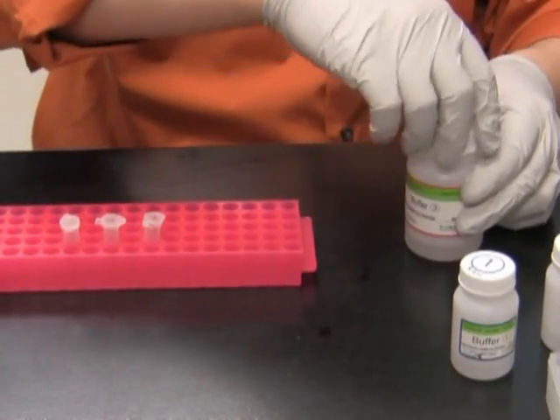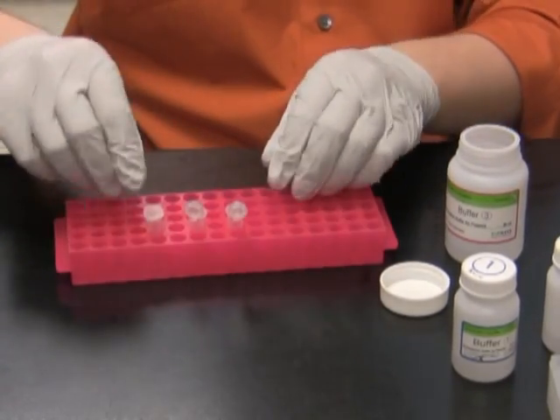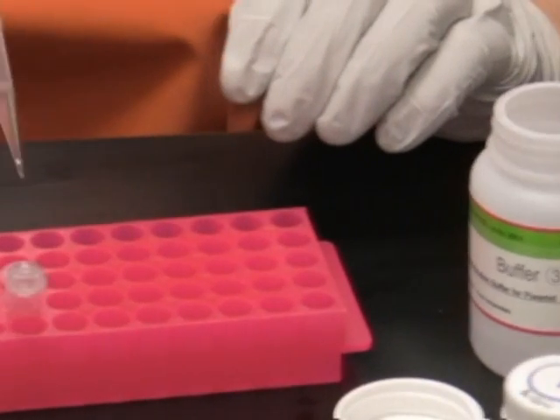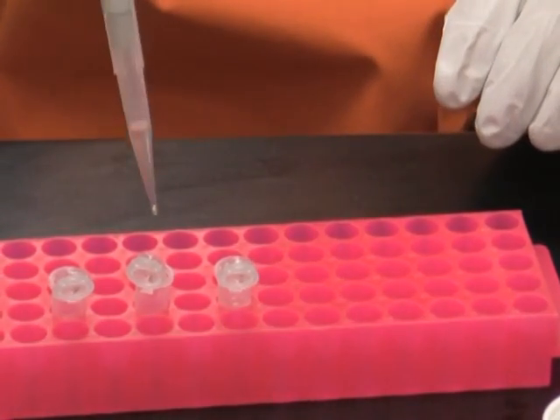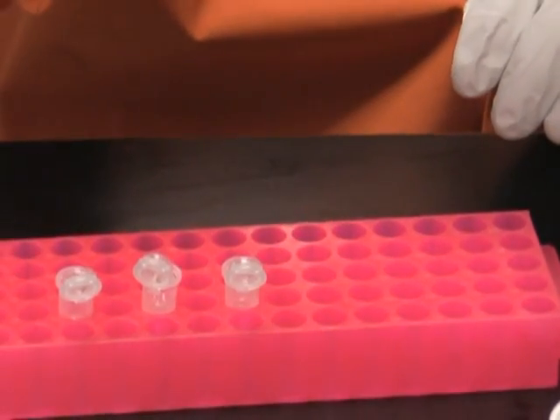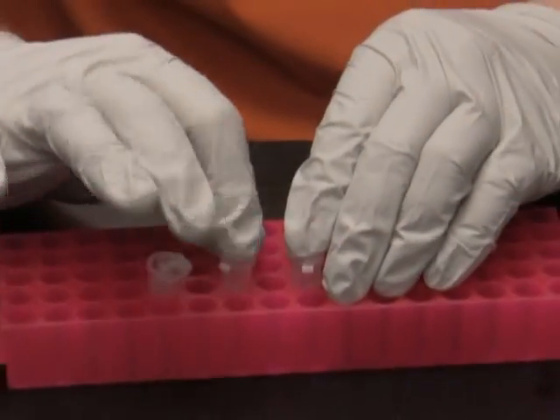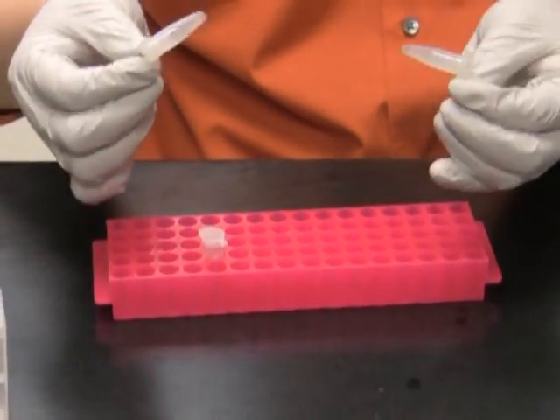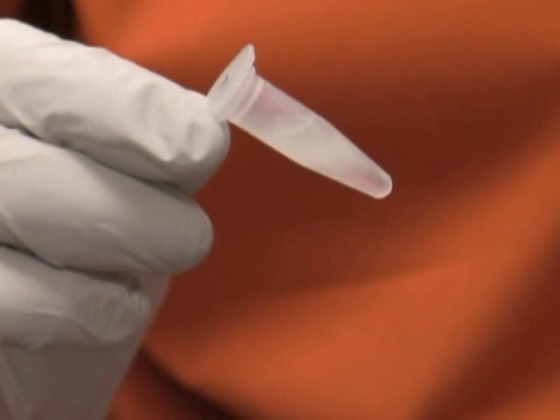Then I add 350 microliters of neutralization buffer to each of the tubes and again mix the solution by gently flipping over the tubes. You can see that there is a cottage cheese-like formation in the tubes which we are going to separate by spinning the tubes for 10 minutes in a microcentrifuge.